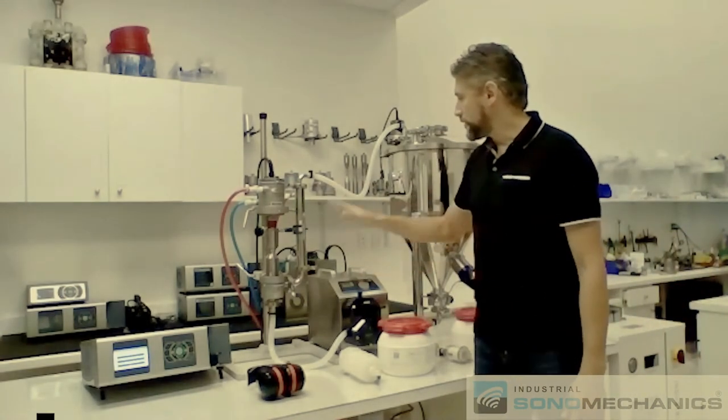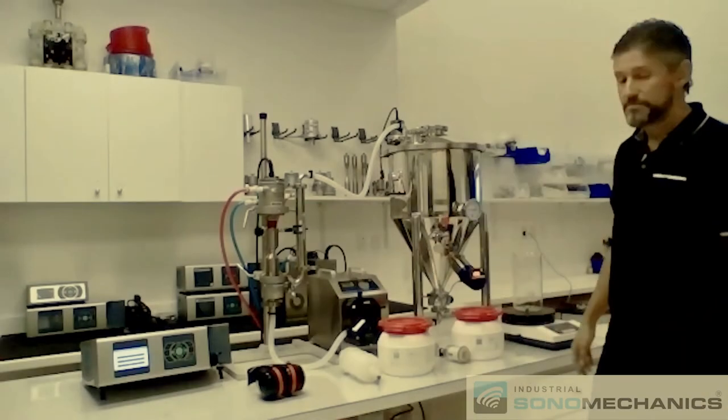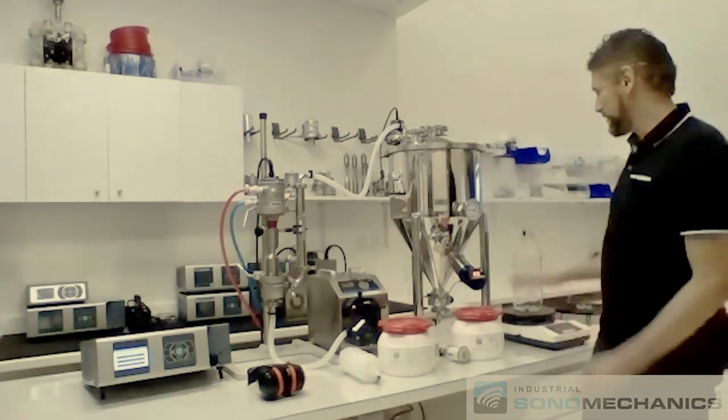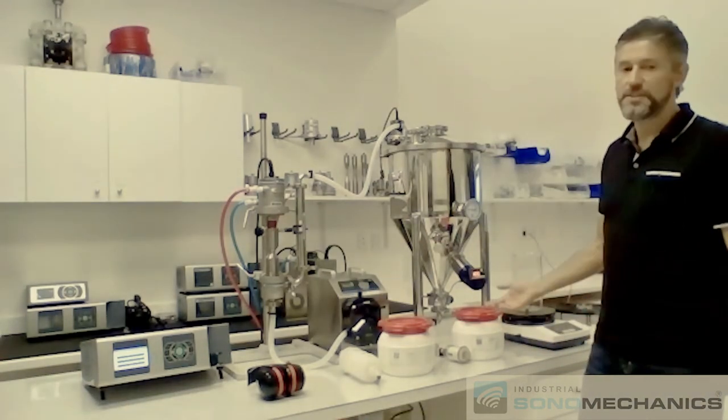So as the process goes on, just watch it and make sure that everything is operating properly, but there's nothing you have to do.